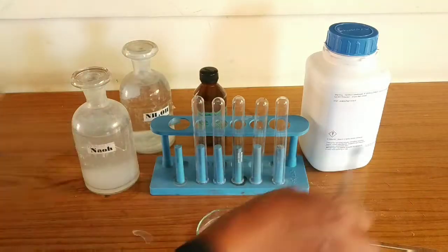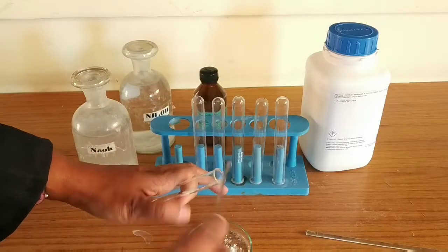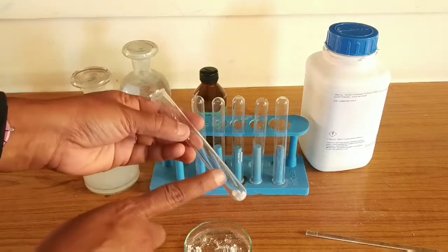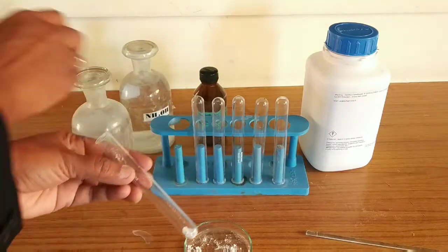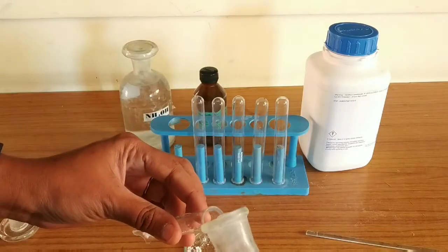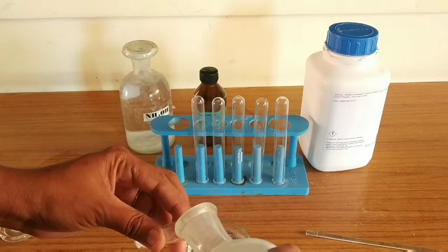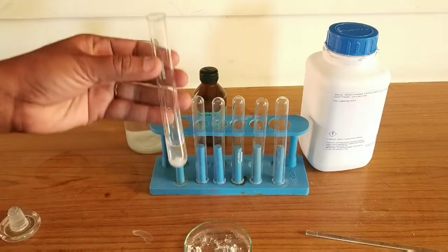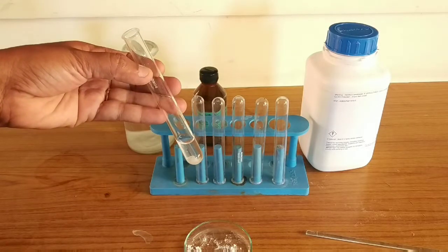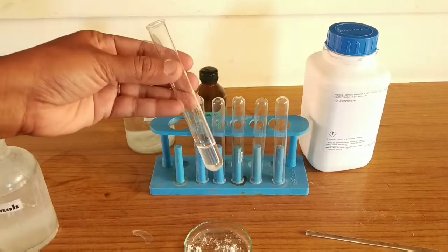First, we take a very small quantity of salt in a test tube. Into this salt, we pour NaOH. The indicator test for ammonium ion requires allowing the salt to react with NaOH. After adding NaOH, you will observe that nothing visually dramatic is happening.